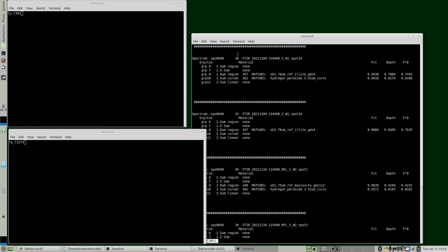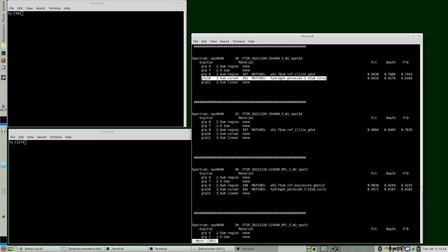This is FTIR, an Agilent FTIR field spectrometer, and Tetracorder found in group 10 hydrogen peroxide. And we know hydrogen peroxide isn't stable on the Earth's surface out in the baking sun. So what was causing that? My intuition during the time was this was trace carbonate.